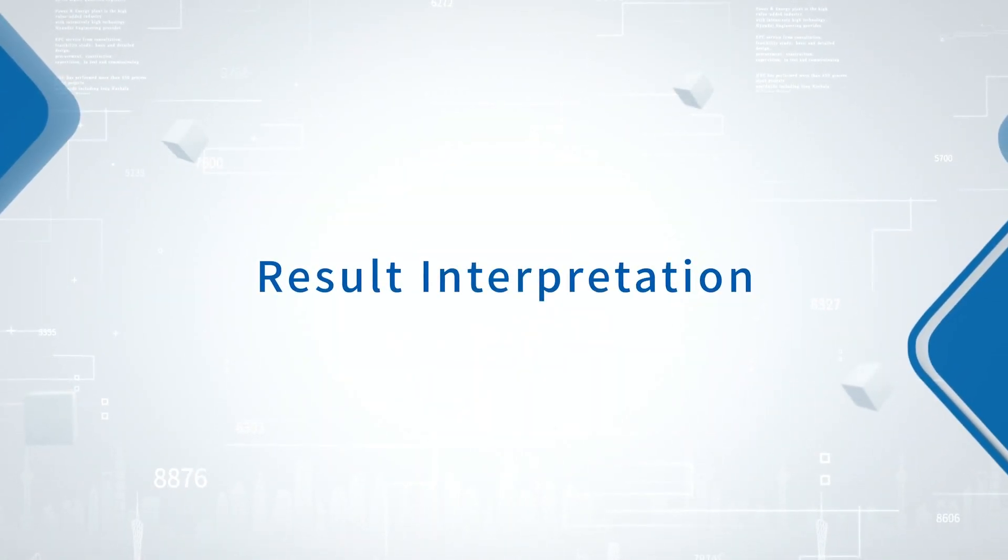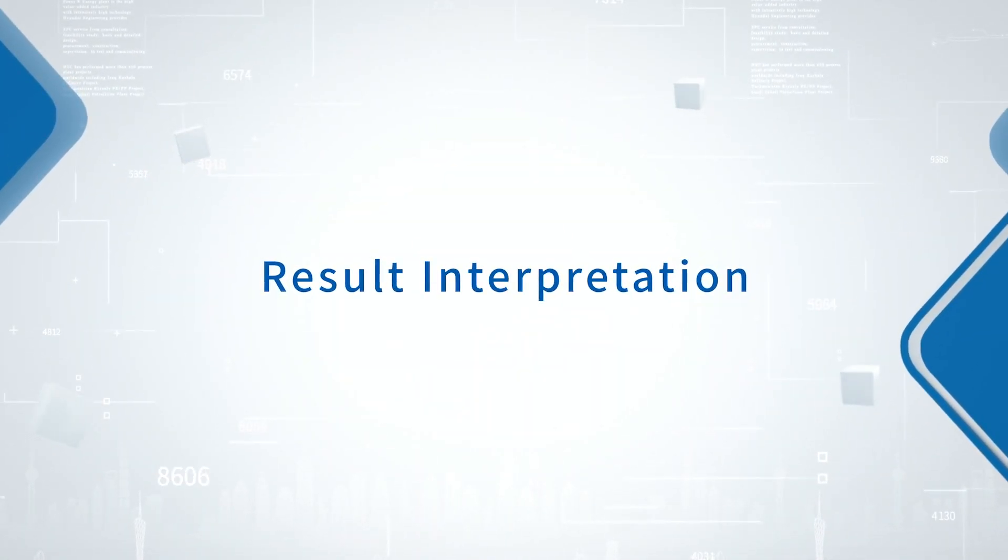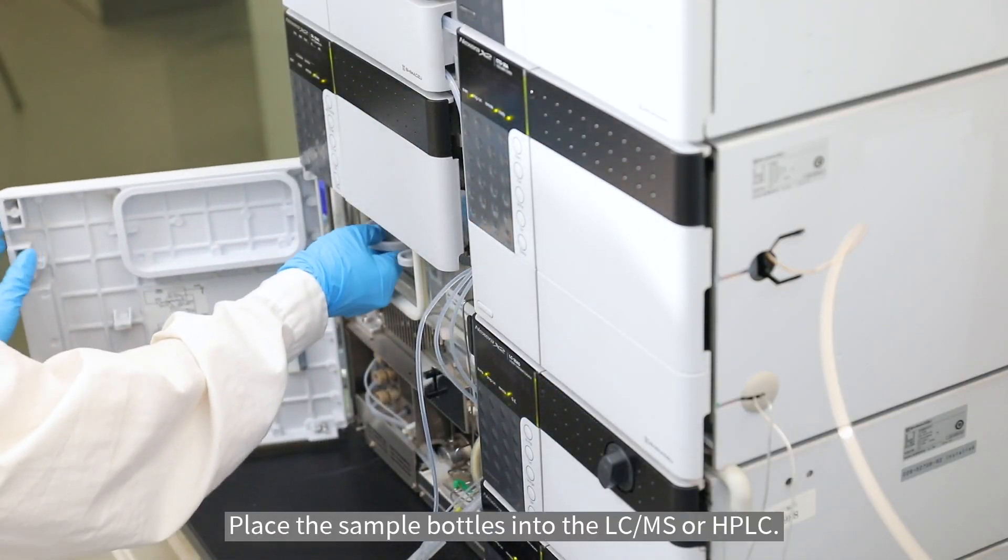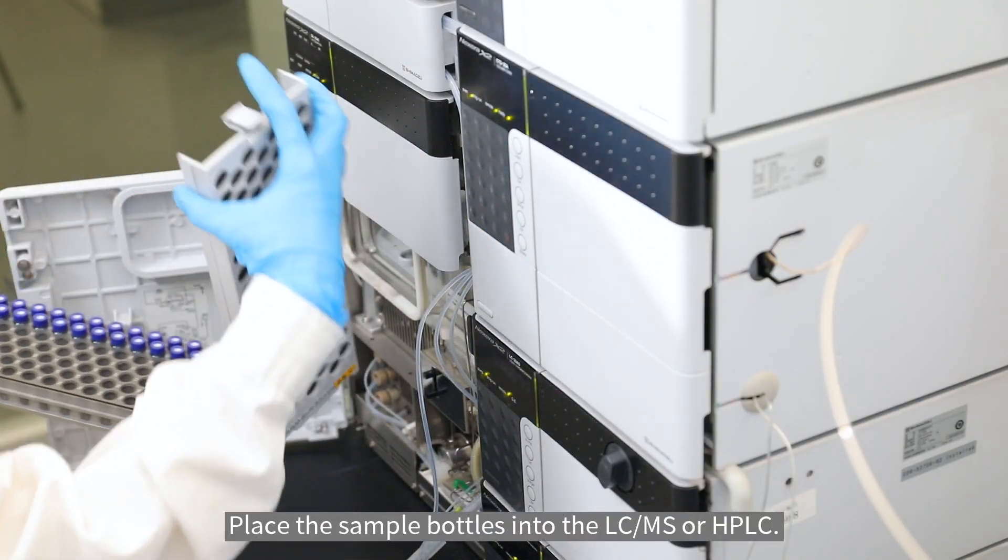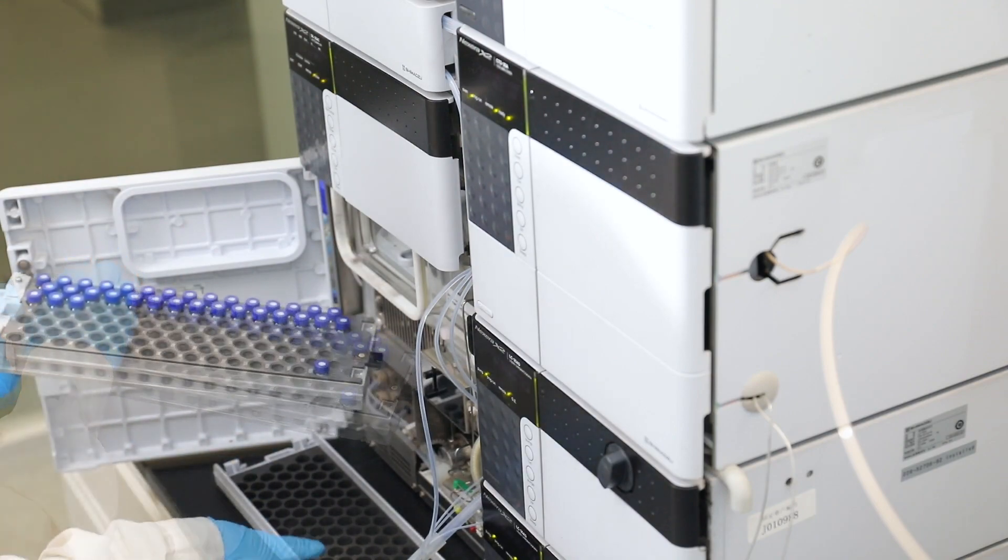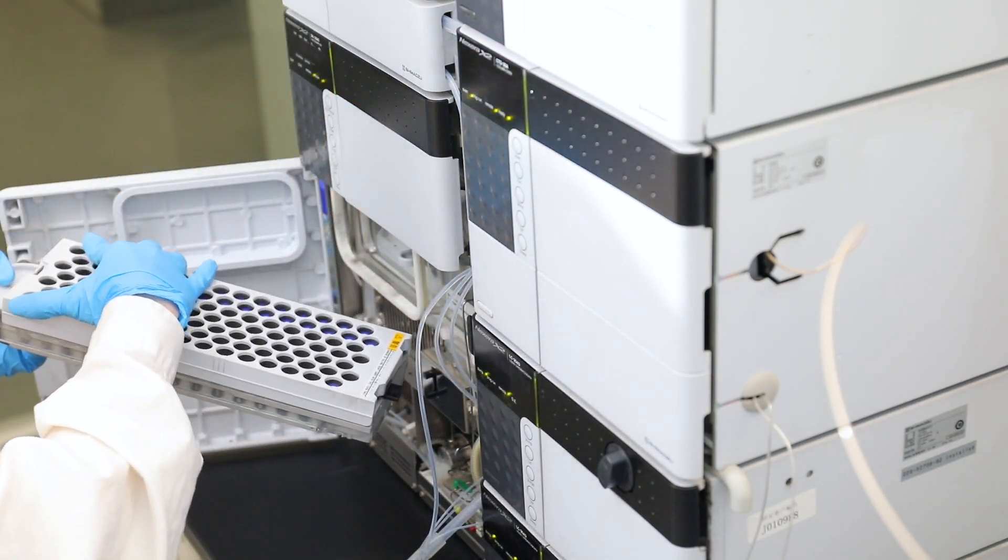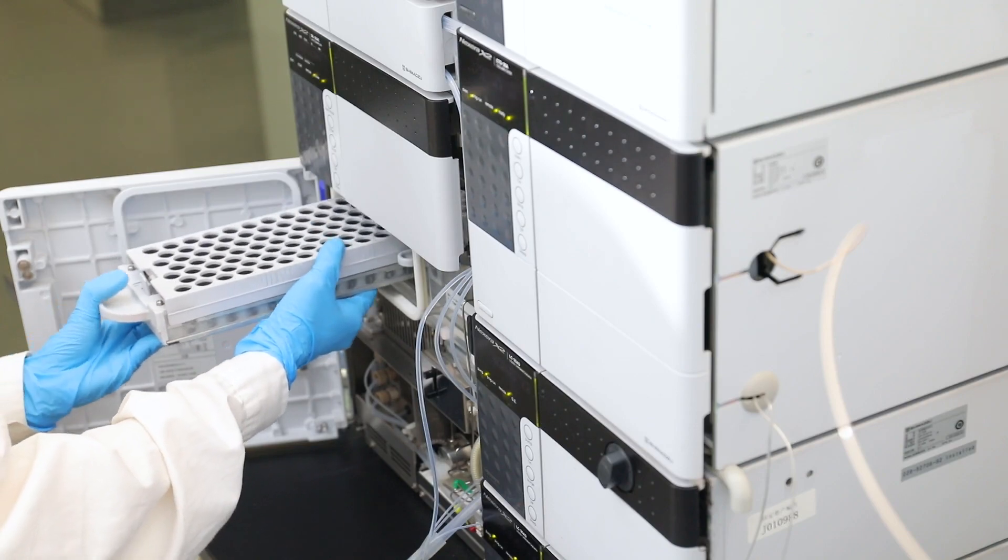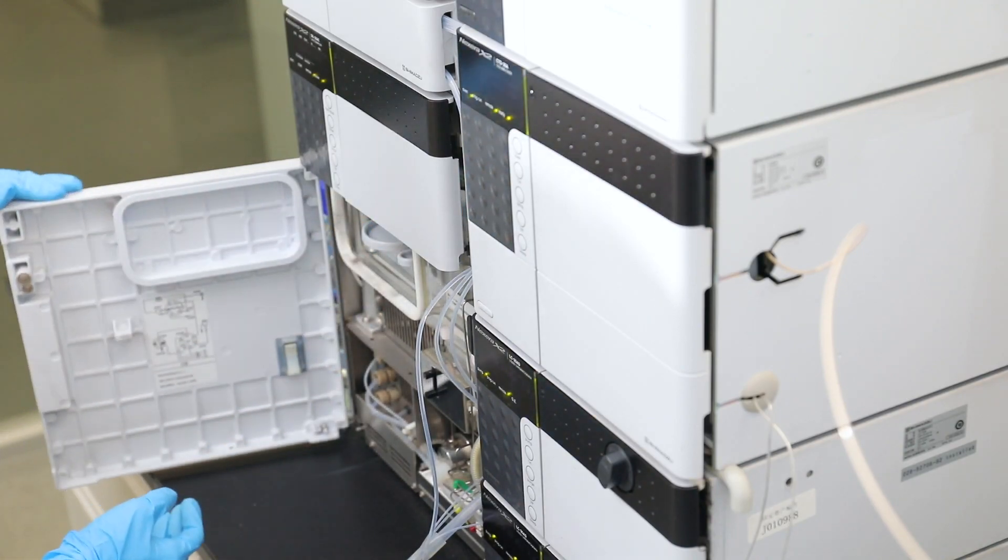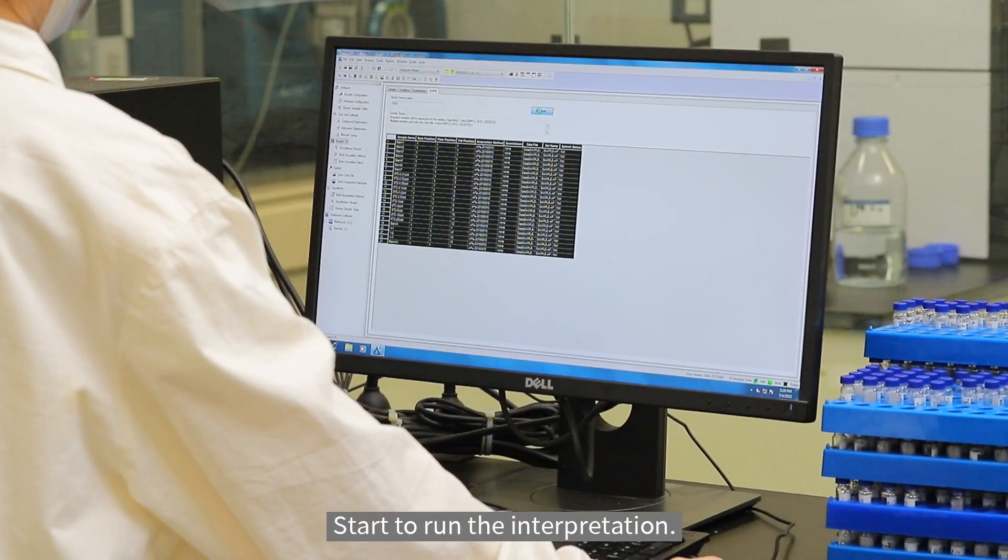Result interpretation: Place the sample bottles into the LC/MS or HPLC. Start to run the interpretation.